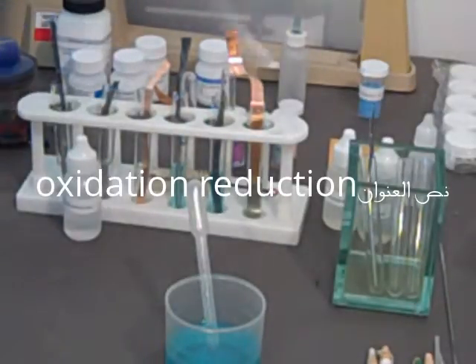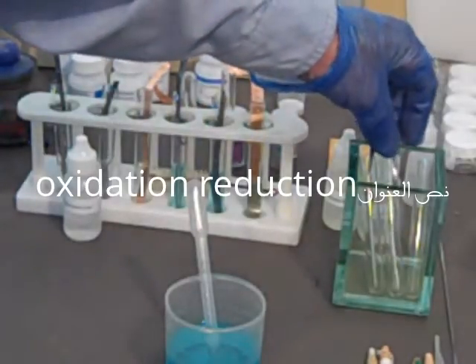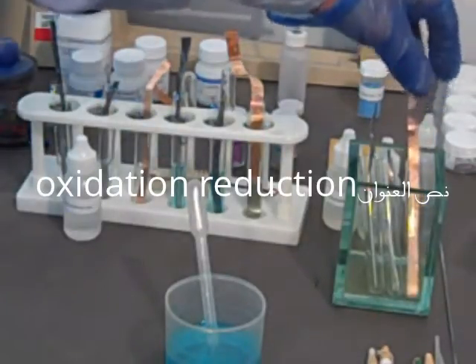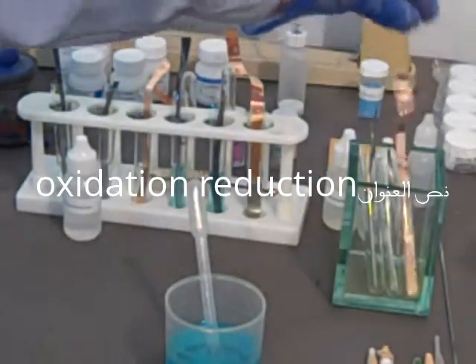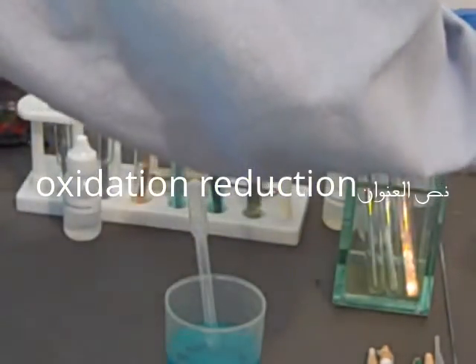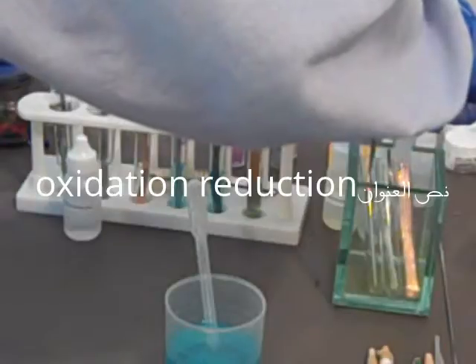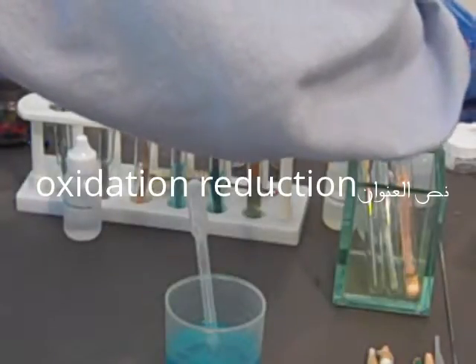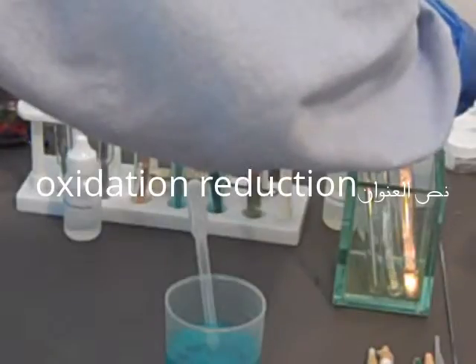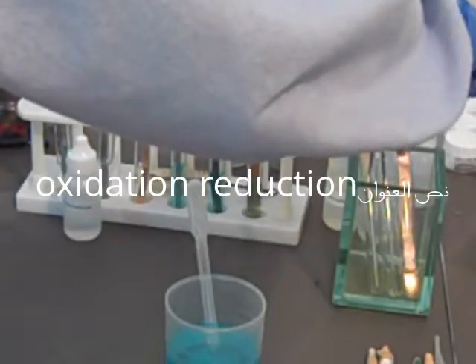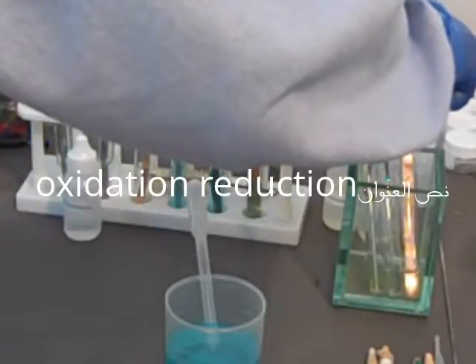Should come with your kit actually—that's what we got. We got it out of a kit. About 3 milliliters into each tube. It's hard to squeeze this. So we don't forget—we can see the copper sulfate because it's blue, but we can't see the lead nitrate. So I'm going to put the lead nitrate bottle in front of the three samples.